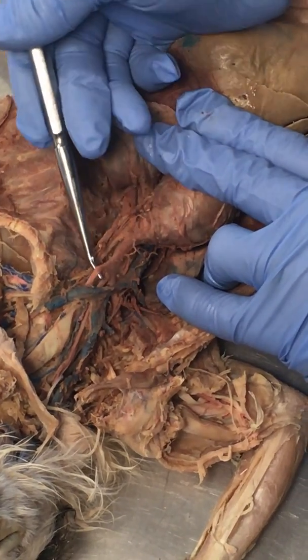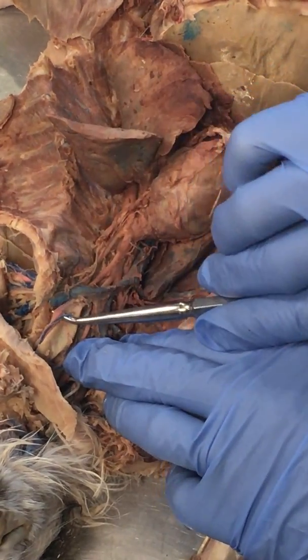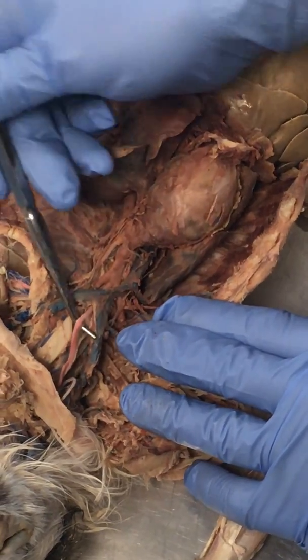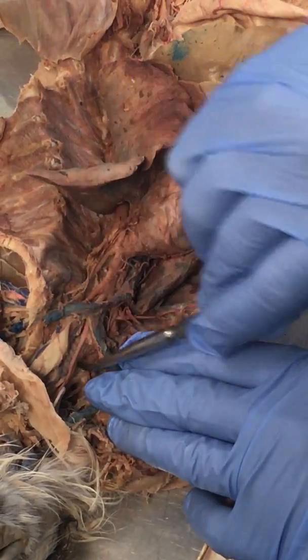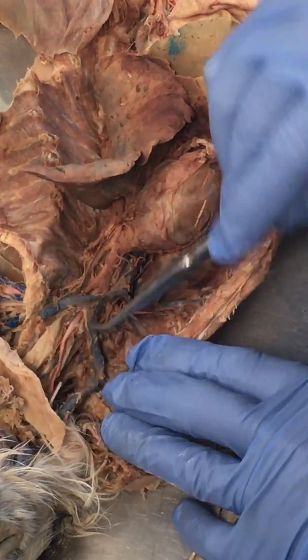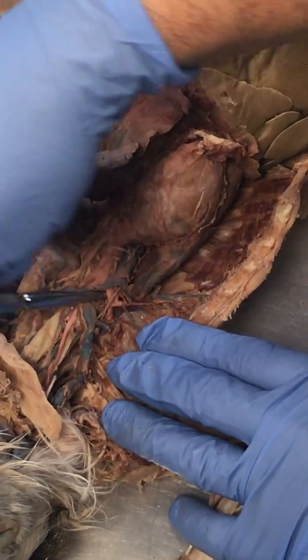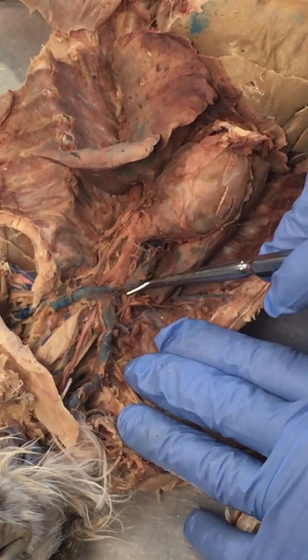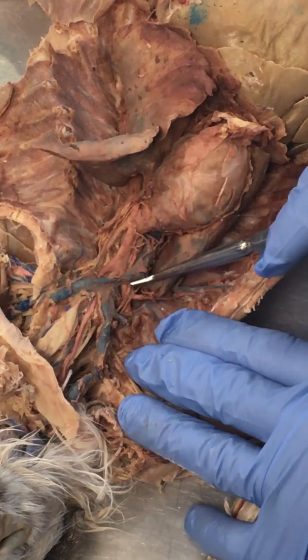So this is the left common carotid artery coming upward, left common carotid. It's not completely dissected off of here, but there it is as well. And then the right common carotid artery is right here. And just so you know, that's the vagus nerve sitting right with it. The little white thing, you see the white thing right there? That's the vagus nerve with it. So that's the right common carotid artery. And then the right subclavian artery is right here. So these are going into the head, the cephalic part, and this is going to the arm, the brachial portion, and that's why we call it brachiocephalic.